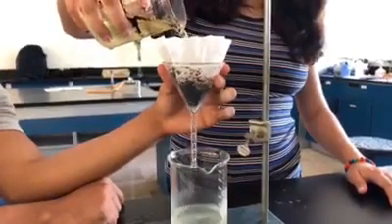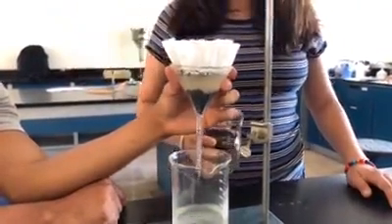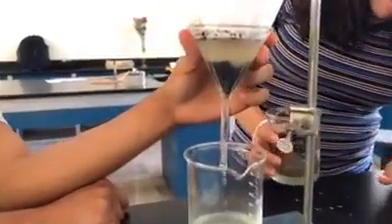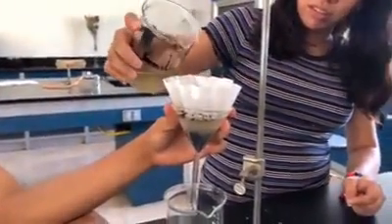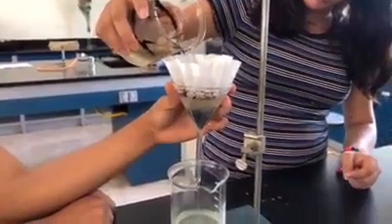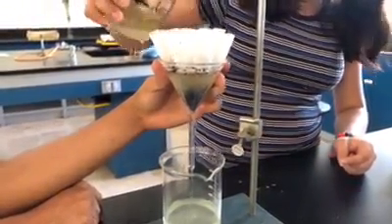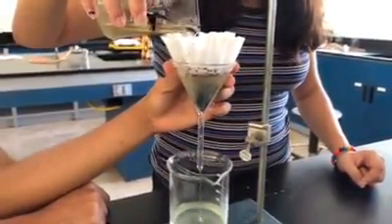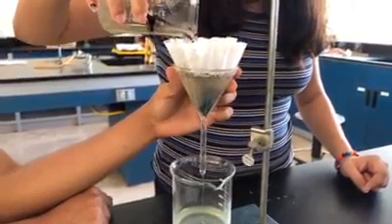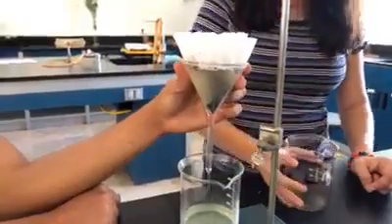Finally, the results we got were that the pH of the water was the same. Initially, we had a pH of 8, and at the end of the experiment, after separating the oil from it, we got 8. On the other hand, the smell changed. At first, we got a smell of organic matter in decomposition, and after the experiment, we noticed that the water had a chemical smell.